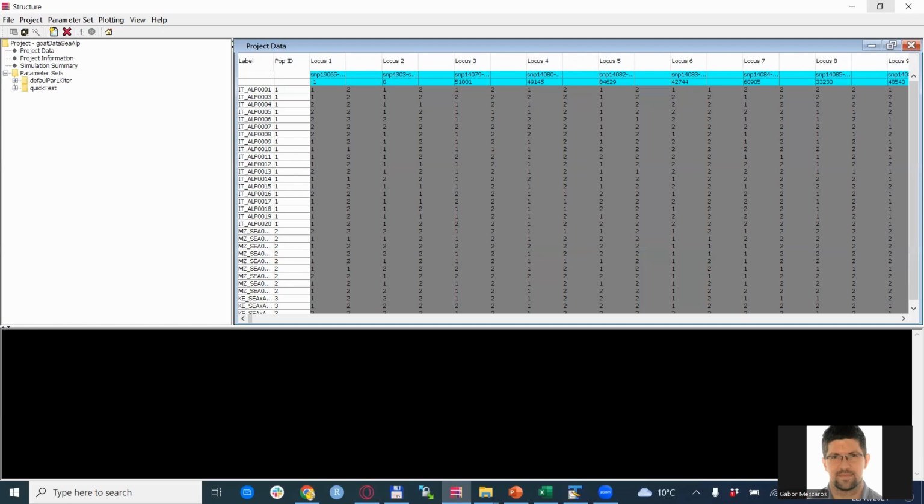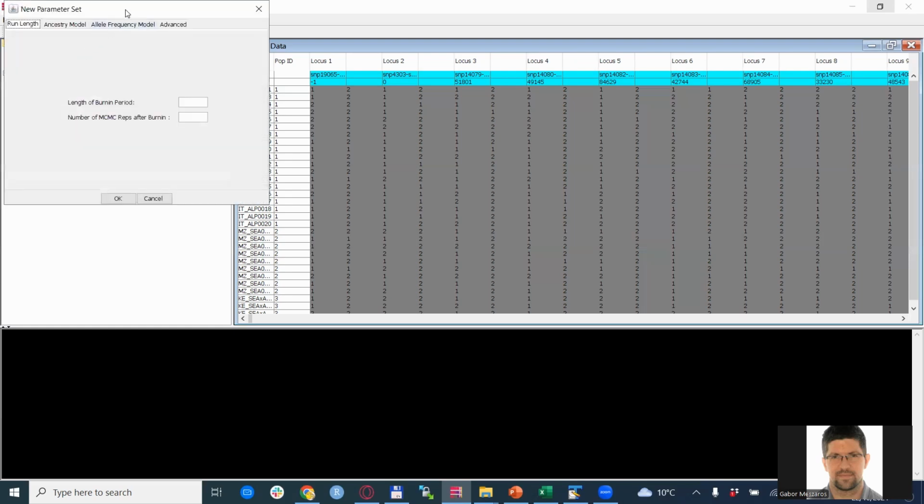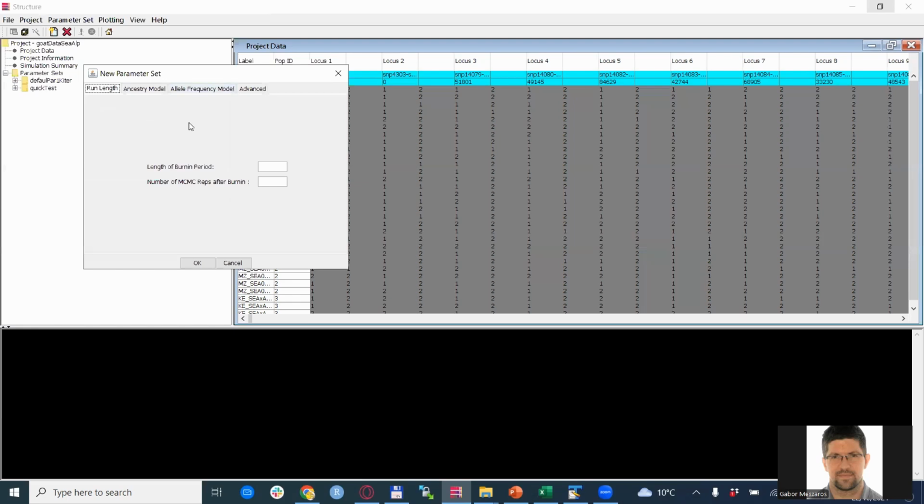So we have the project data loaded, and now we want to run structure. The first thing that you need to do is to create a parameter set for the runs. Here I have already some that I used before, but let's say that you are just starting, so you don't have any. Then you can create it easily by clicking the parameter set and creating a new parameter set from the top banner. Now, you can set many things, but for this particular example, we will set only the burn-in period and the number of MCMC iterations after burn-in.